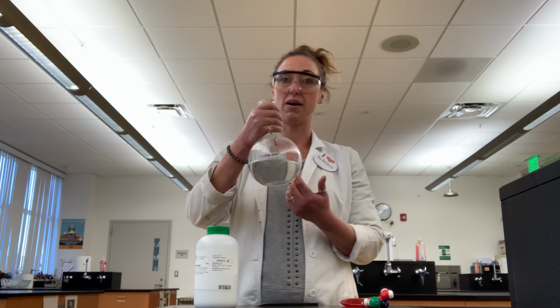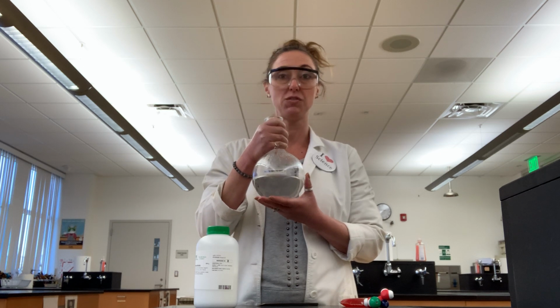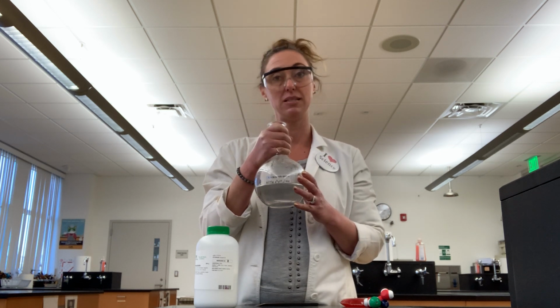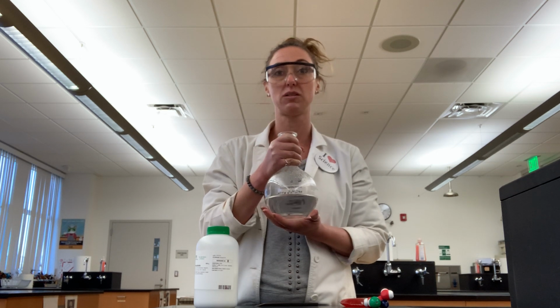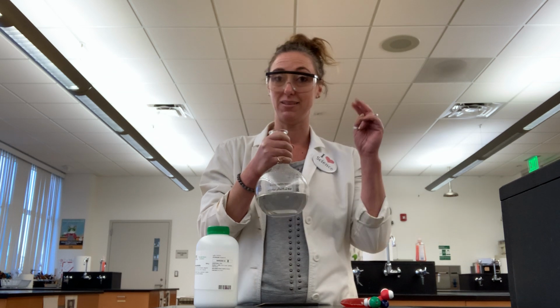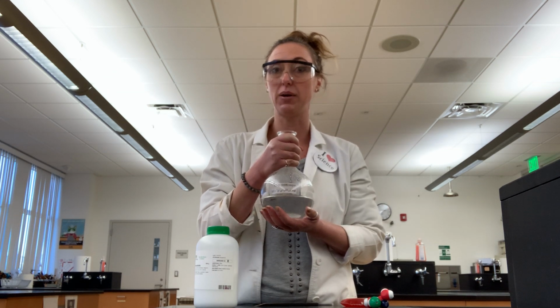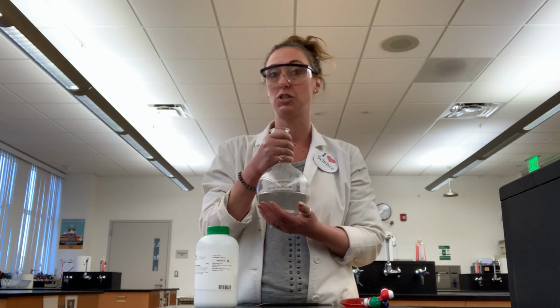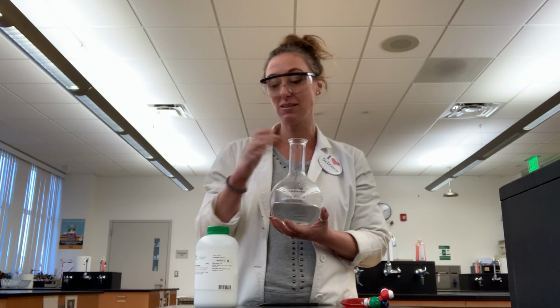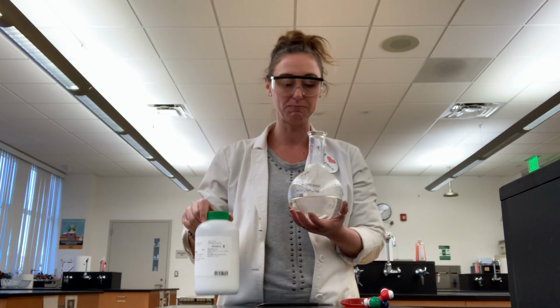And that's what I've done here, where I have a bunch of sodium acetate, just a little bit of water, and I've melted it down on a hot plate and let it cool back to room temperature. Essentially, I've tricked it into being a liquid, or an aqueous solution, at room temperature, when in fact sodium acetate is supposed to be a solid, okay?